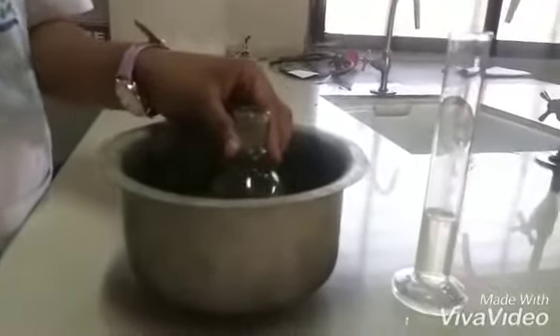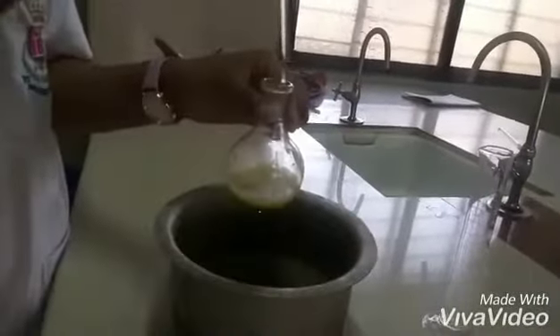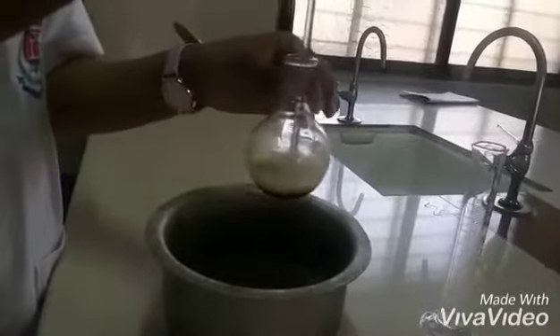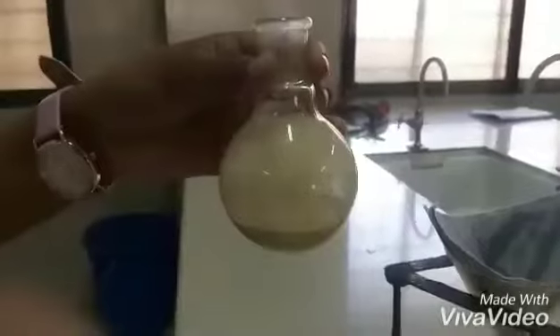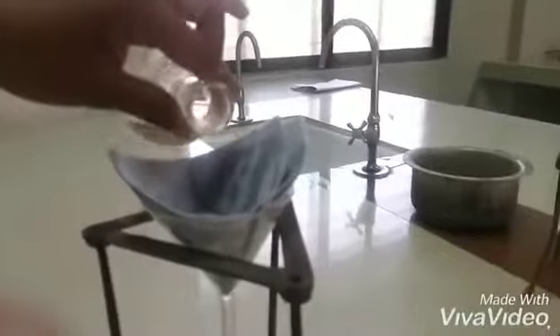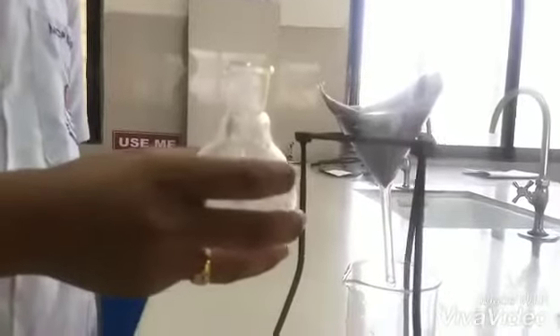After cooling, add 20 ml of cold water to the RBF and stir it with a stirrer. Filter the content from the RBF into the beaker.